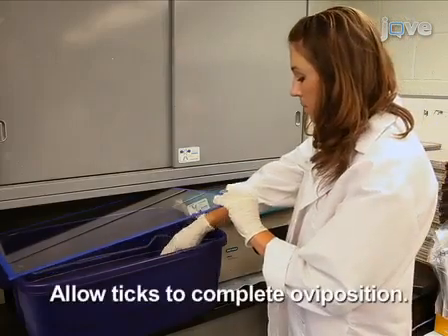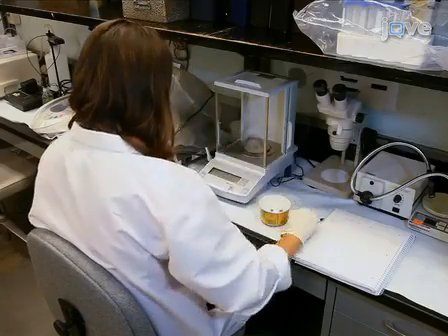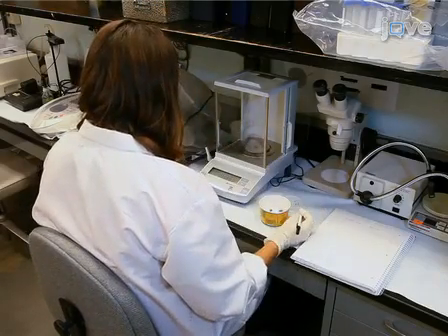Incubate each group of ticks in the humidity chamber until the completion of oviposition. Evaluate oviposition by group by weighing the egg mass produced by all the ticks in a group.